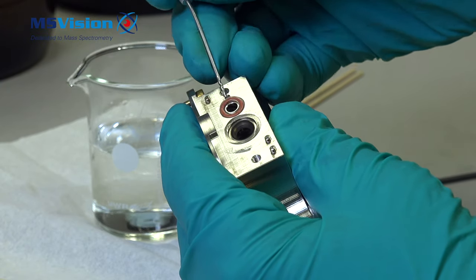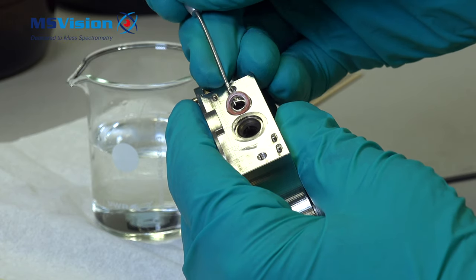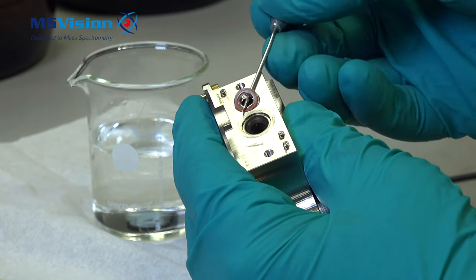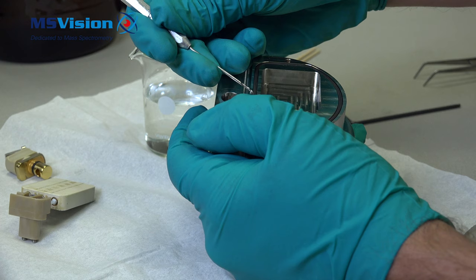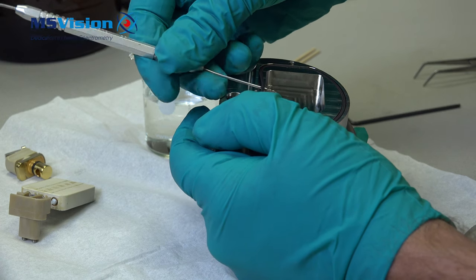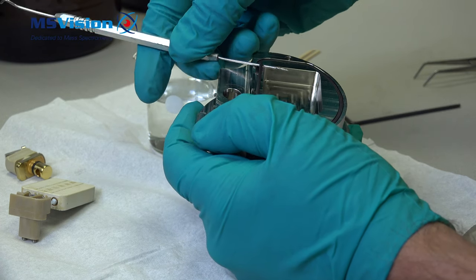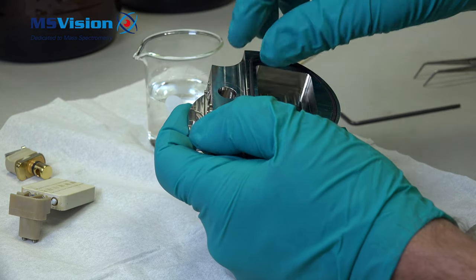Now with a dental tool or a very small screwdriver we should be able to lift out the o-ring. Also here there's a small cutout to help remove the heater plate o-ring. Be careful so that you can reuse it.